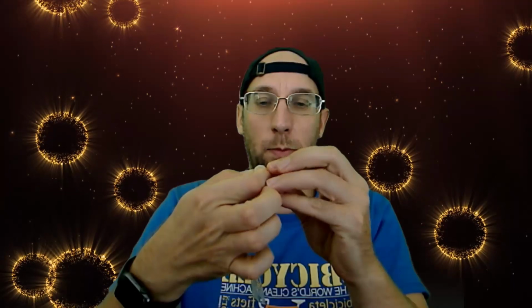Okay. And what we're going to do, we're going to turn them into cell membrane. And so we open it first of all. It is actually a tube, and we're going to close the other side. Put a knot on the other side. Okay, it's just like tying a balloon. So you tie it, and we're just trying to seal it up.